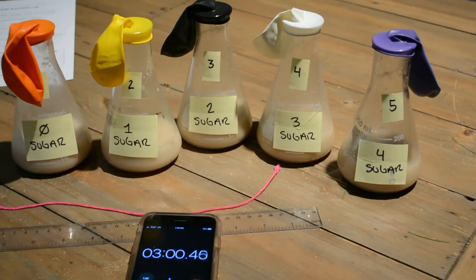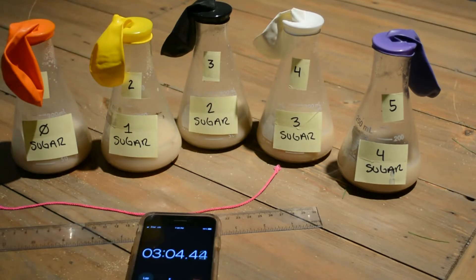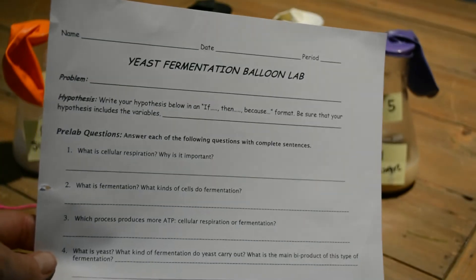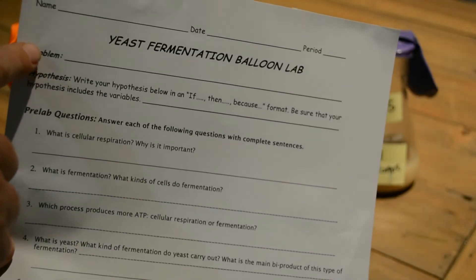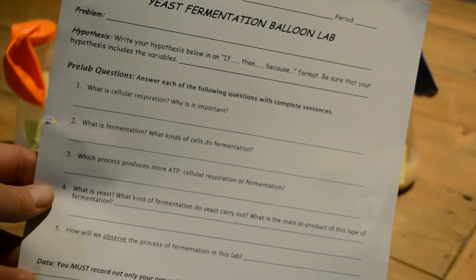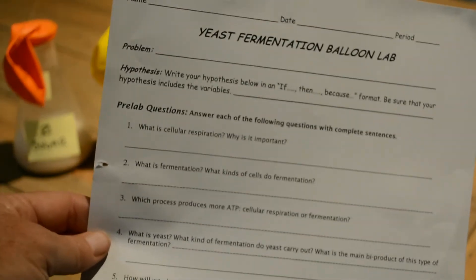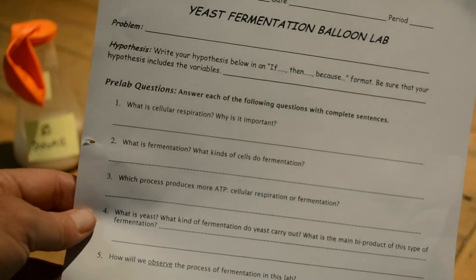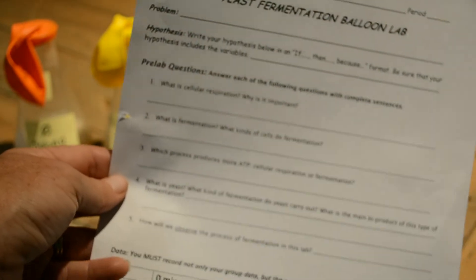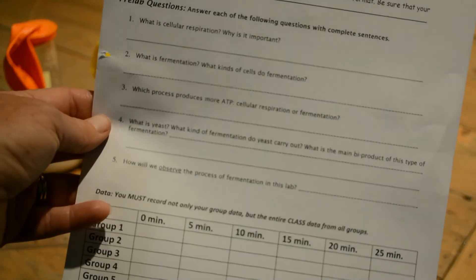Make your hypothesis on your lab report. Write down what it is that we are researching — so what is our problem? Write your hypothesis, remember to include 'if... then... because.' While we're waiting, go ahead and answer some pre-lab questions: what is cellular respiration, what is fermentation, and what are you actually observing in this lab?